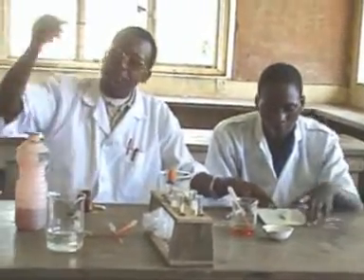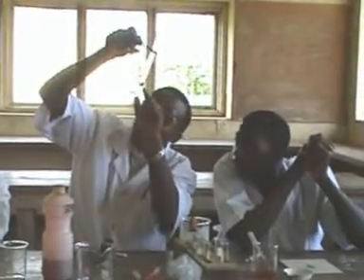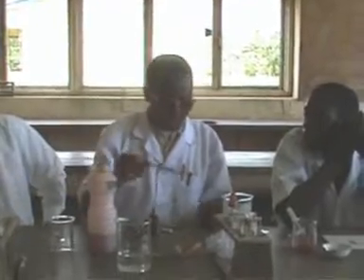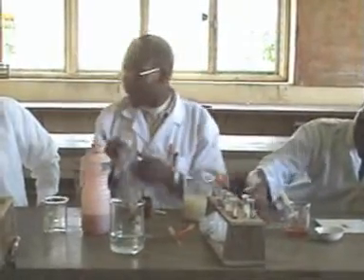And then in my own case, you see that with time, the brown color is now well distributed. So this is just implying that after 5 minutes, when I'm observing without heating, there's a brown color and the precipitate now has increased. I can see the precipitate on here, which is very, very distinctly red. So what I will give from here as a conclusion is that the solution A, which we are given, contains fat.